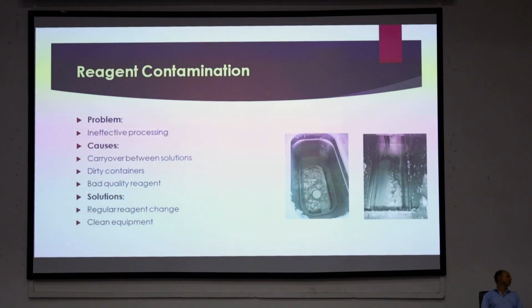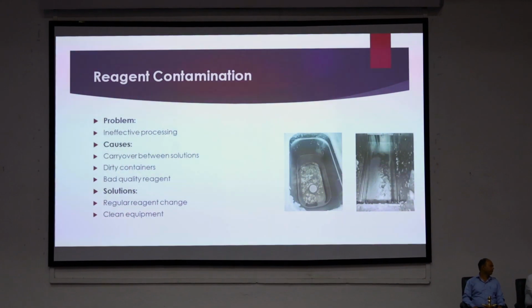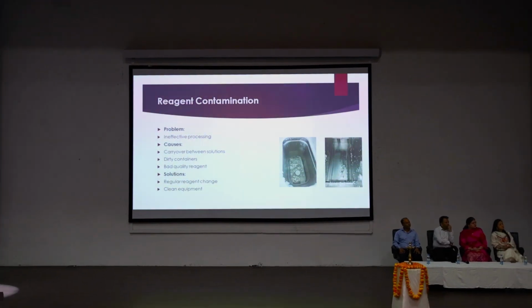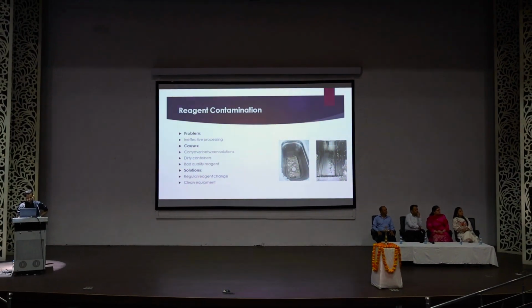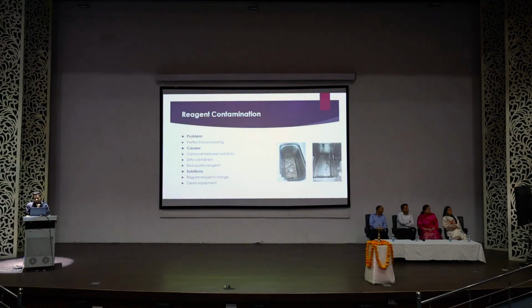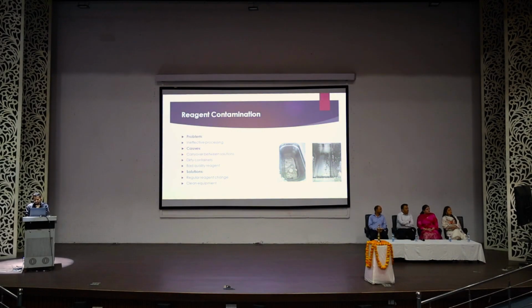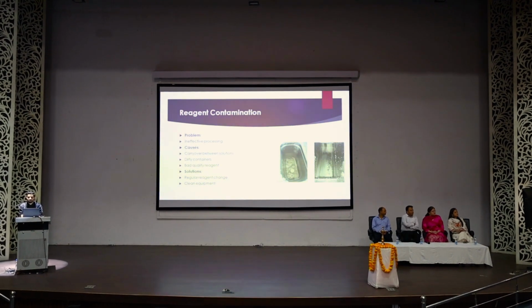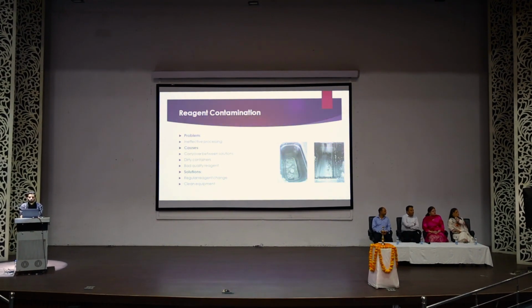Now, reagent contamination. Here the problem is ineffective processing. Causes are carryover between solutions, dirty containers, and bad quality reagent. You need to change reagent regularly and clean the equipment. If you see, these are two wax tanks which became dirty only after consuming bad quality reagent. So you should always replace bad quality reagent with good reagents.